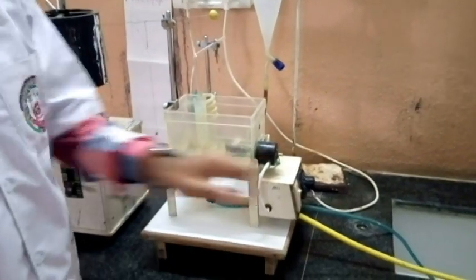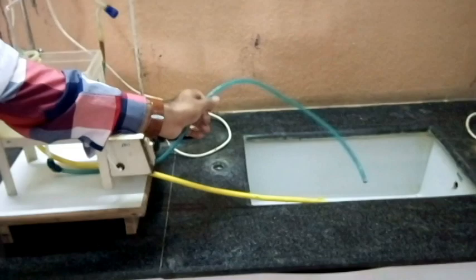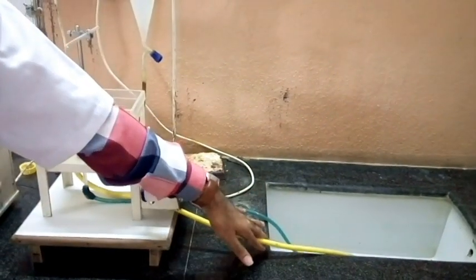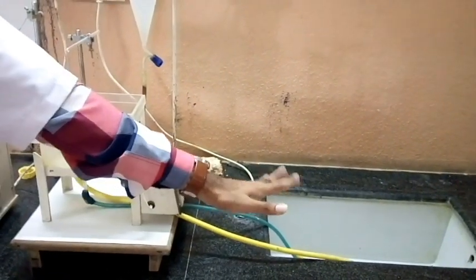Finally, the last component of the student organ bath are the two outlets. One outlet is for the inner organ bath and the other one is for the outer organ bath. Once the experimentation is done, I remove the clips which are attached here and the entire water is flushed out.